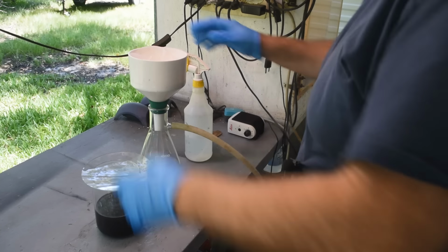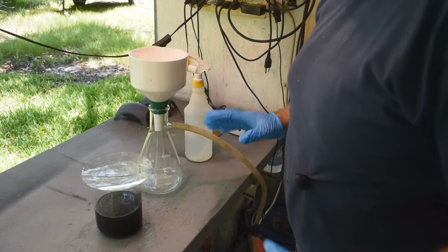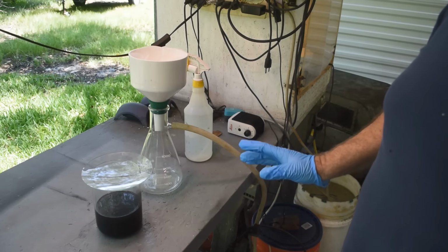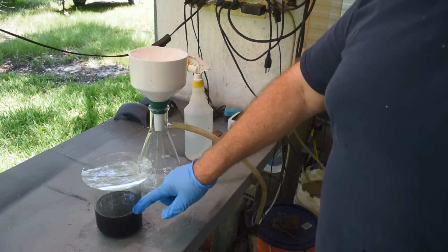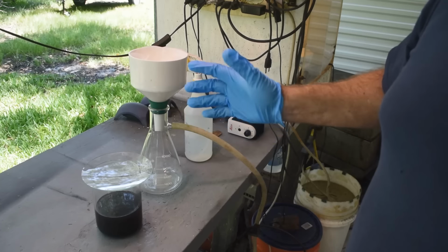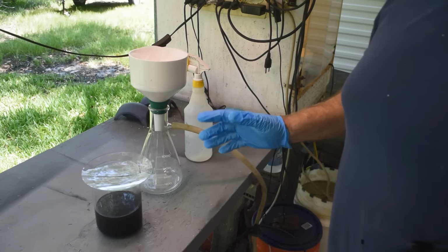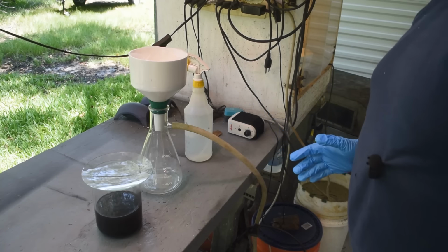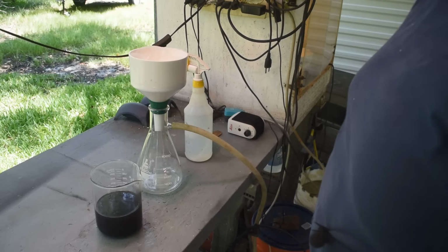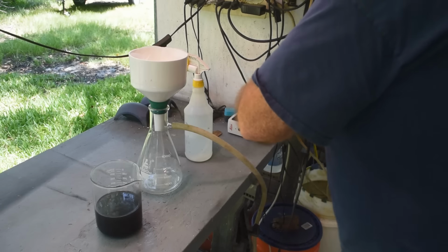Plan B, I guess. I wanted to end up with palladium powder, which I could just easily weigh and add to my collection of palladium powder. And obviously that's not happening. So plan B is I'm going to try and capture all this on a filter, and then we'll melt it down and make a button, or a bead, and weigh the bead, and see how much palladium we've got that way. It's not my preferred method, but we'll give it a shot. Hopefully this stuff isn't so fine after boiling that it goes right through the filter and into the vacuum flask. Guess we'll find out here in a second.